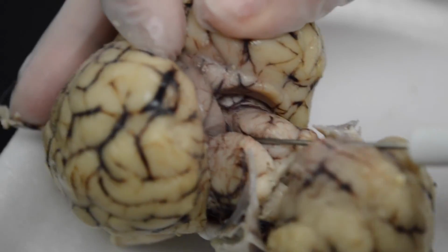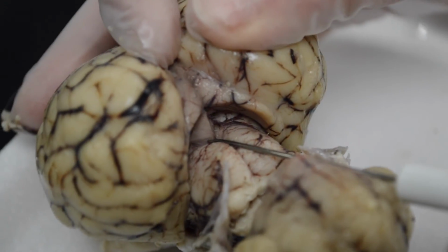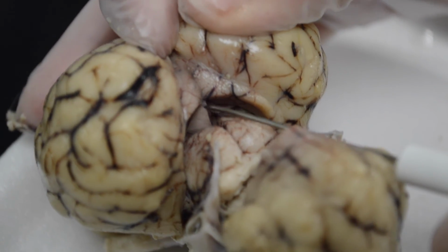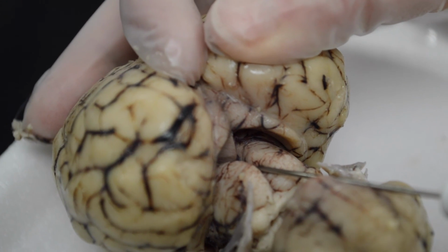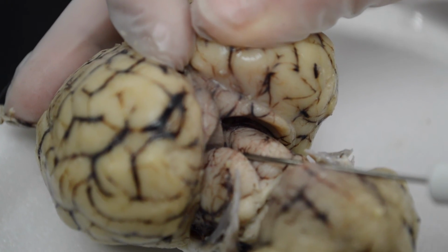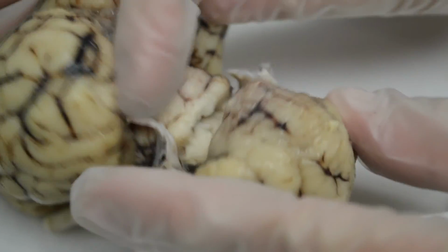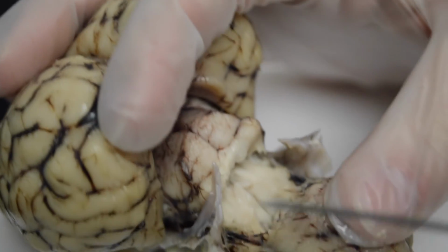Just above that, very deep in there, you will see a structure that's part of what we call the epithalamus. It's the pineal gland, and it comes to a point there. You see the very tip right here, closest to us, and it sits on top of the corpora quadrigemina. And the pineal gland has to do with sleeping, right? Regulating melatonin, the release of melatonin and sleep. So that's the pineal gland there. There, that's a good view.